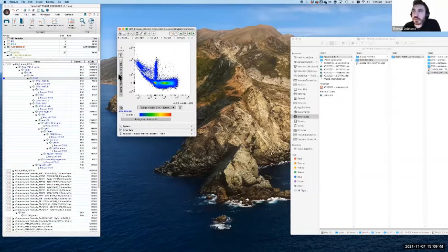So here we have, in this case, PE-CF594 on the y-axis, and this is BV605. Now, on the face of it, this looks like a classic overcompensation. As the data is getting higher, it's leaning over, but actually it's clearly not the full story, for two reasons. One is that this is still here, and the other is that there are two kind of separate spillover issues happening here. This doesn't look like classic overcompensation. And yet it's all happening in stuff that is positive in this detector. This is where things get a little bit tricky to work out.